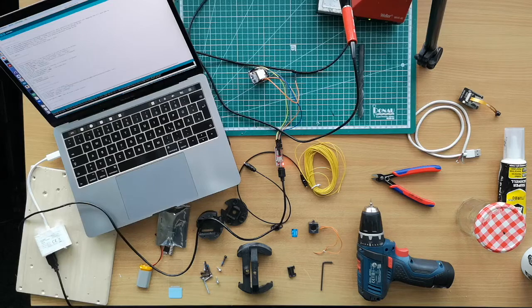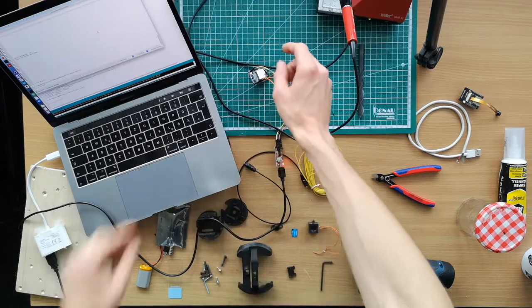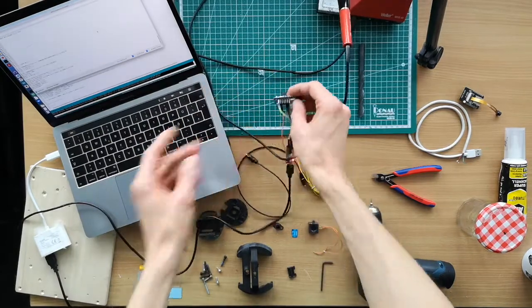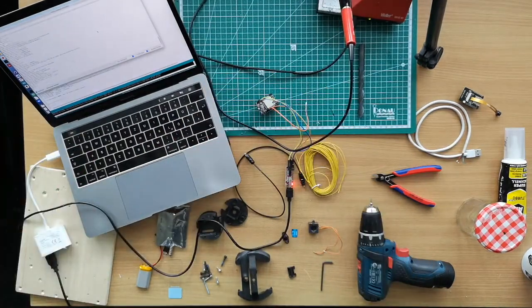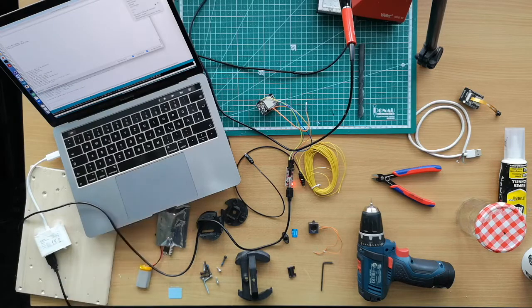So now the firmware is successfully uploaded, and we can check again, going to the serial monitor and hitting the reset button here. Then you will see a bunch of output here. The Anglerfish software will start. It will search for the SSID, which by default is Blink, where the password is 12345678. And if it doesn't find it, it's automatically saying, I haven't found it, so I'll open a new access point.